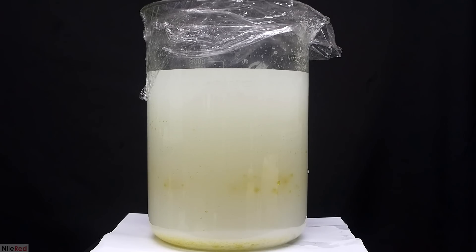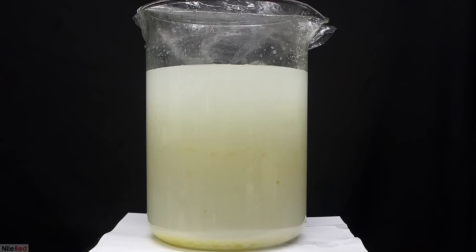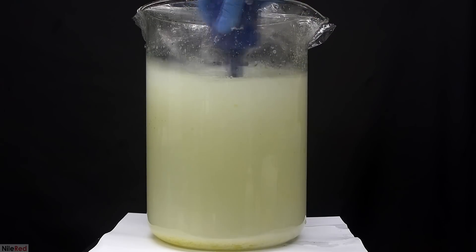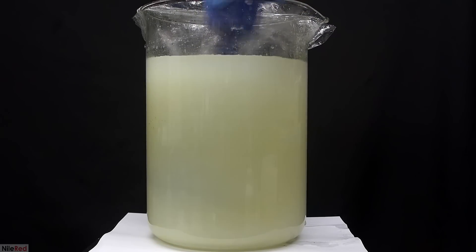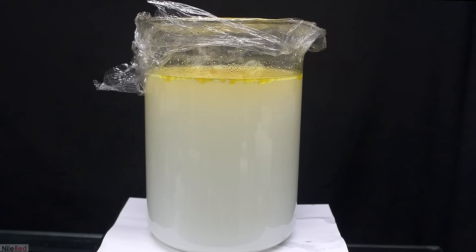There was some oil that settled out at the bottom, but as salt is added, you can see it starts to float to the top. We need to thoroughly mix the salt into the solution and in theory I should have used a spoon or something, but I didn't have one so I used a broken piece of a plunger. After it's been mixed thoroughly, I let it stand for a while and I let the oils float to the top.